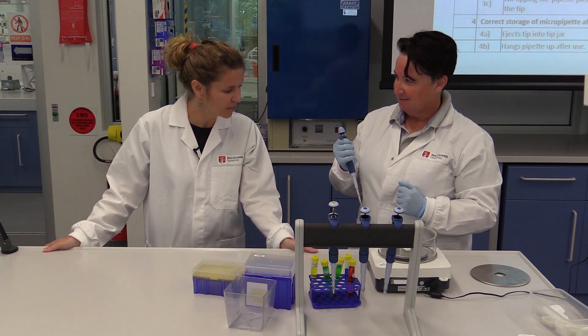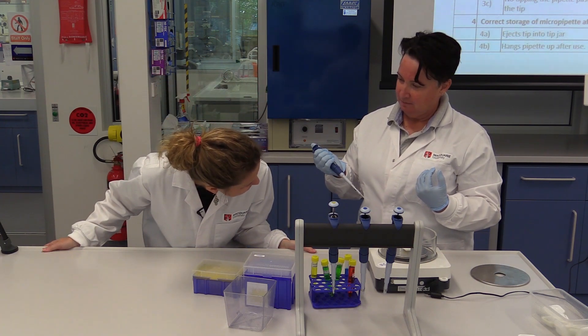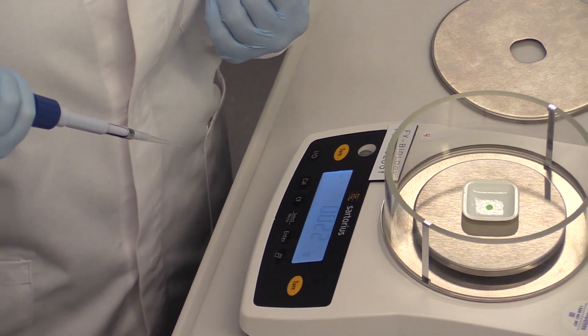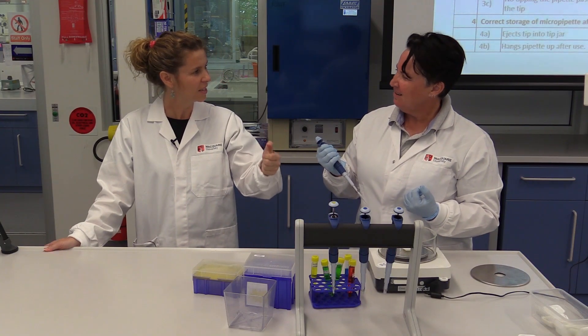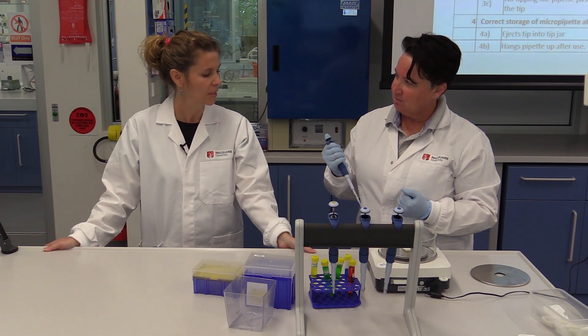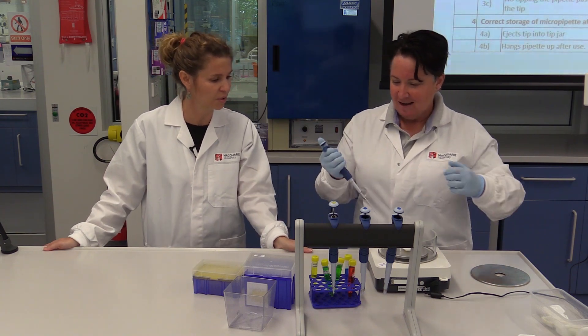But... that's weird. Yeah, because... I feel like I didn't do something right. It seems that you have a little bit of liquid in your tip. Did you push it till the end? No, I don't think I did. So next time you push till the end. Should I go a bit slower as well? Yeah, as well — I think it was like super rushed.